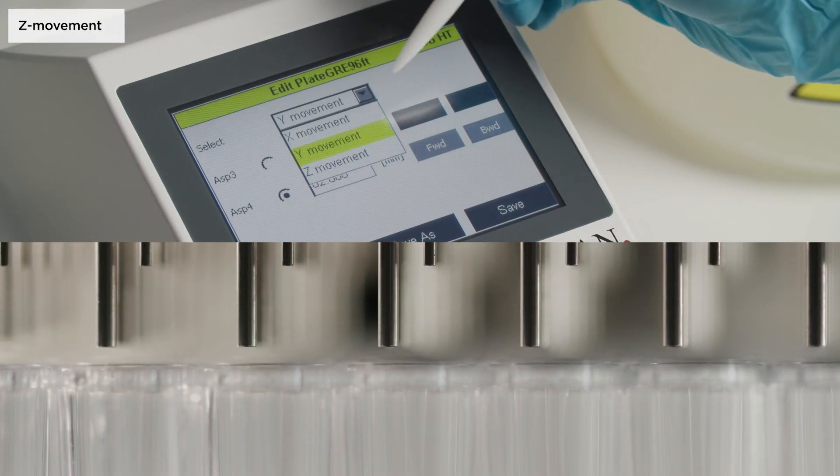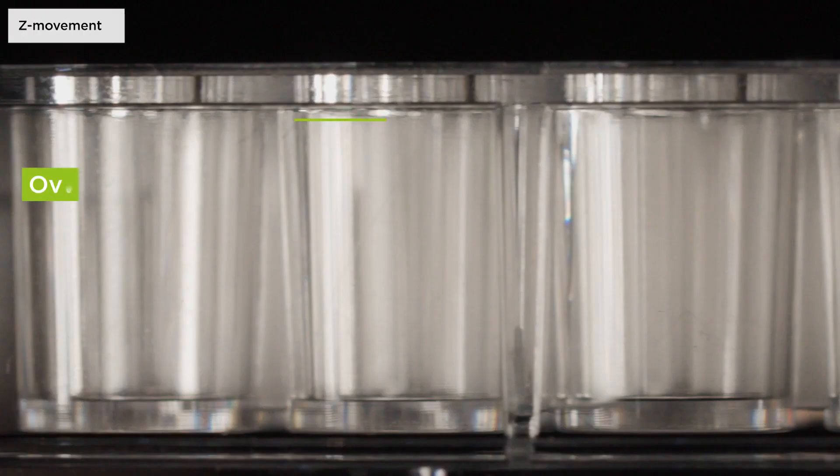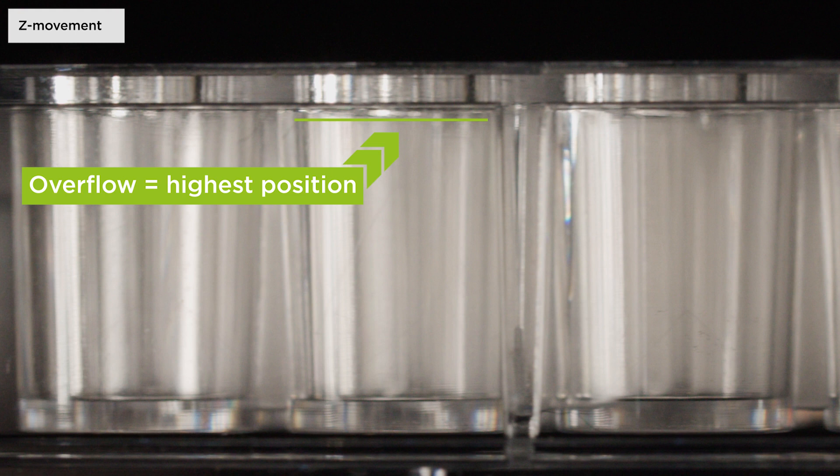Z movement is the position between the well bottom and the aspiration needle. Overflow is the highest Z position in the well and bottom is the lowest position.